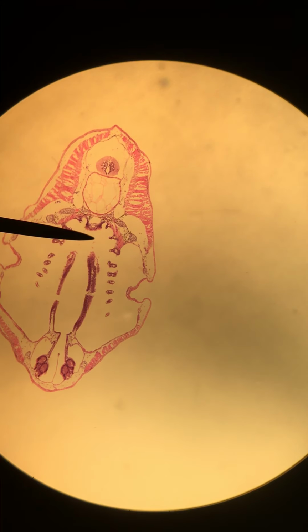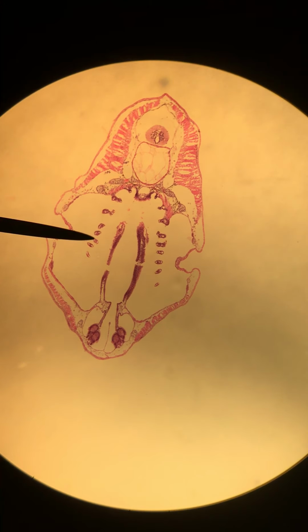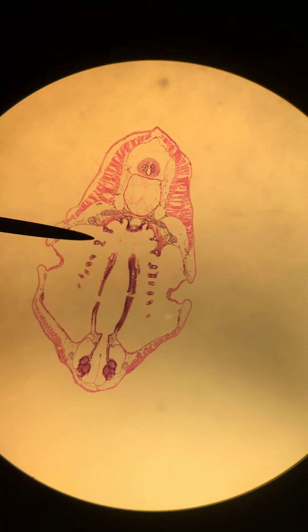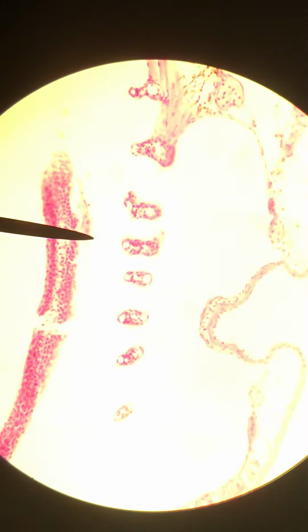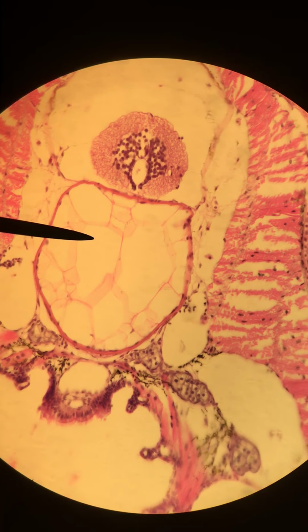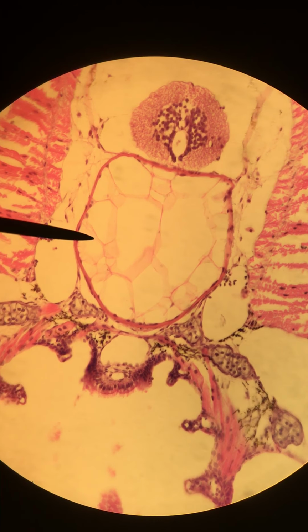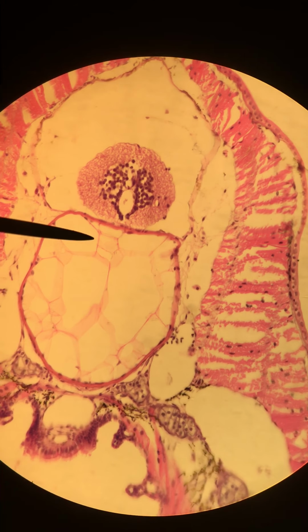On the ventral side, we've got our pharynx and the gills here. These little fragments are parts of the gills. I will zoom in a little bit so you can see that closer. I like to point out that the notochord here looks a little bit like adipose tissue. If you remember from last semester, we were looking at our fat droplets, and it looks sort of like that. And of course, the spinal cord looks very much like what we looked at last semester.